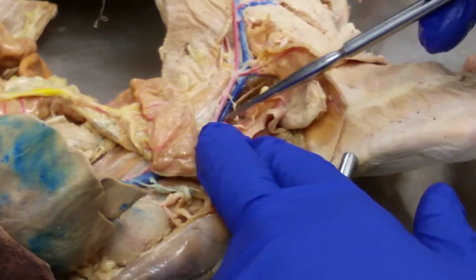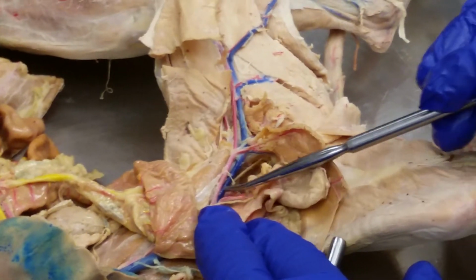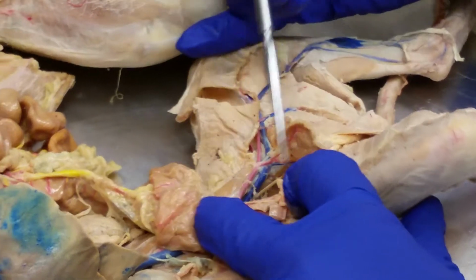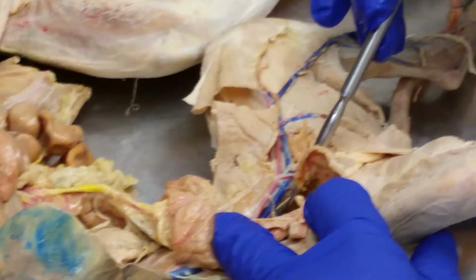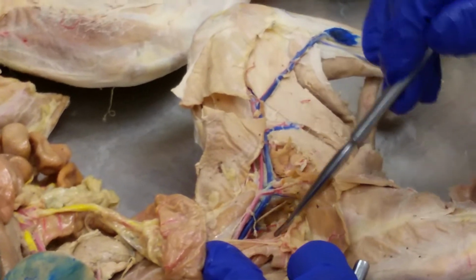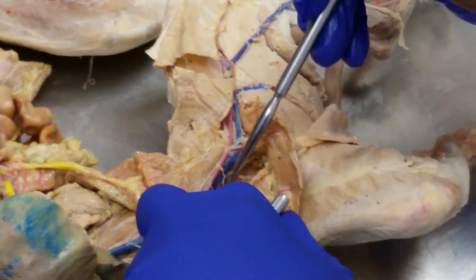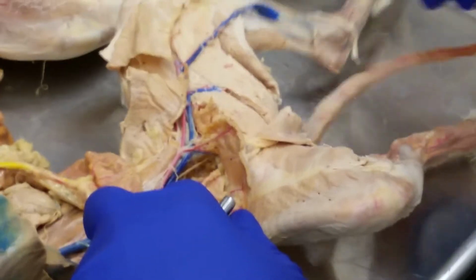Okay, and then I do this here. So we got our common iliac vein here, our external iliac artery here. Okay, and then you could see here, if you were to do this, you can actually see that you have the internal iliac vein, and then the caudal artery just kind of continues there. You see, this is the caudal artery, and then it goes back there. The caudal artery, and we get the vein there too, supplies the tail.